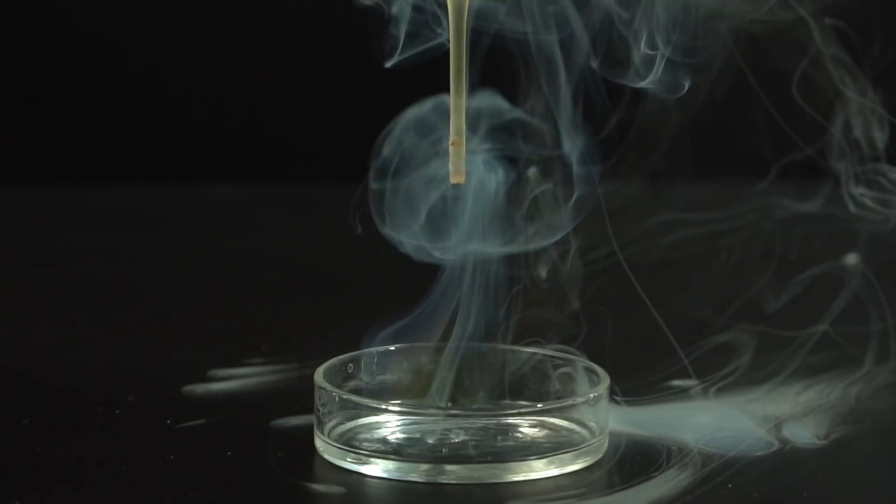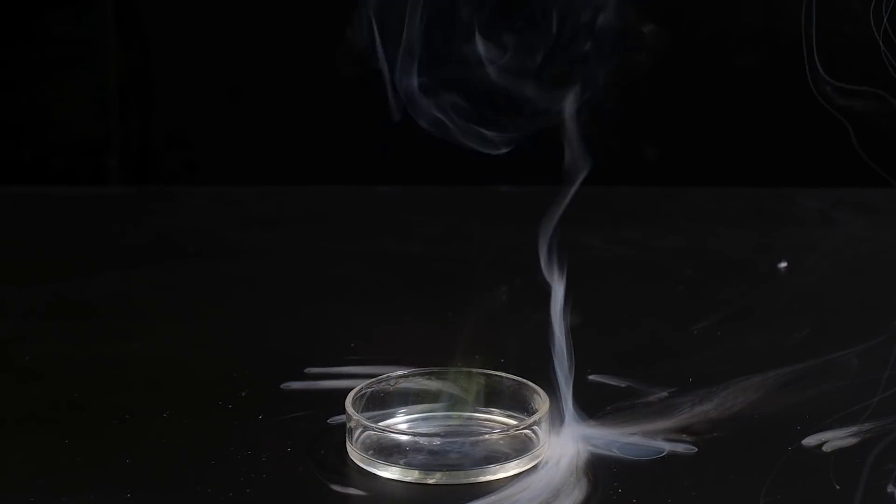You can see methanol ignites spontaneously during the reaction with boron tribromide.